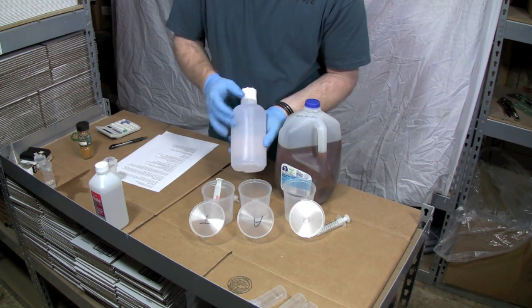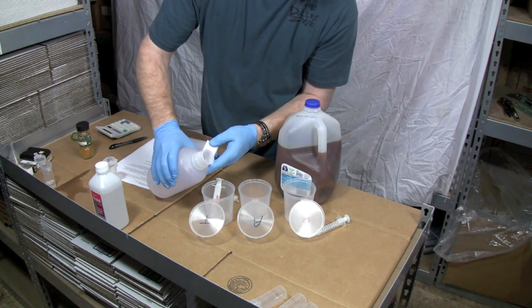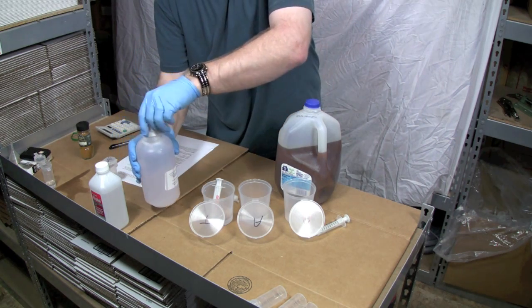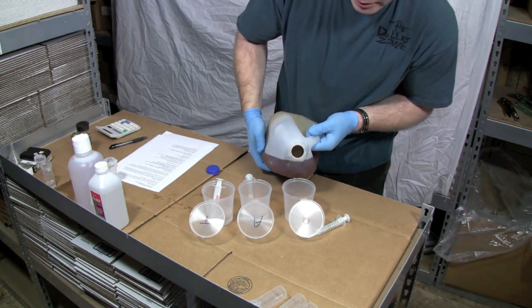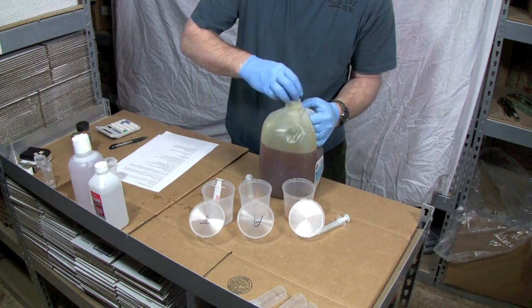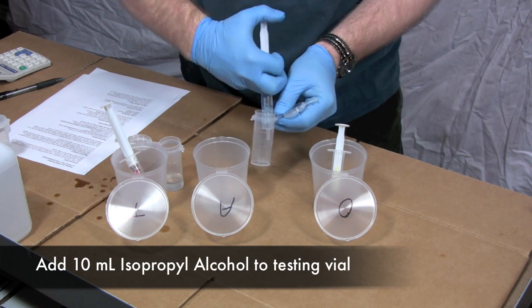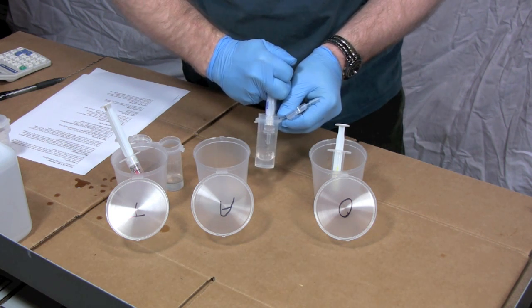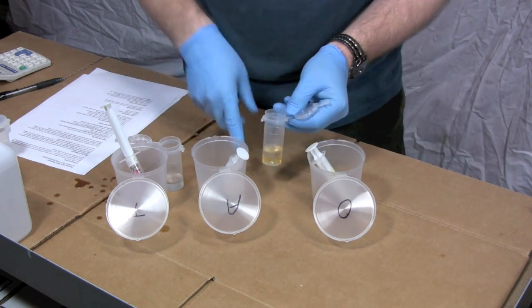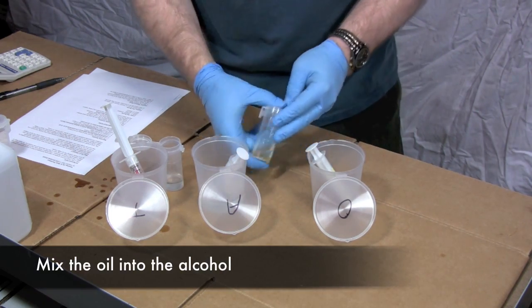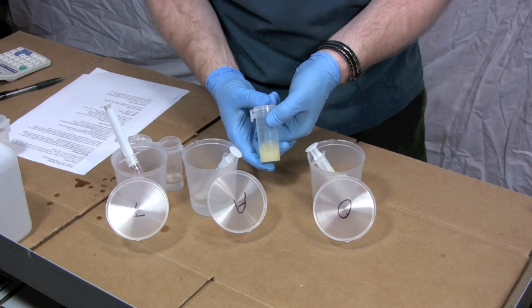Our titration solution is now fully dissolved. The potassium hydroxide is in here. So I'm going to put a little bit of that into our titration cup. And then I'm going to put a little bit of oil we're going to be testing. Nice goopy oil. We're going to do the titration by putting 10 milliliters of isopropyl alcohol into our vial. We're going to put 1 milliliter of oil into here. And then I'm going to cap this. Just shake it a little bit to make sure we fully dissolve that oil sample. You'll notice it's going to look kind of yellowish. That's okay. That's what it needs to look like.